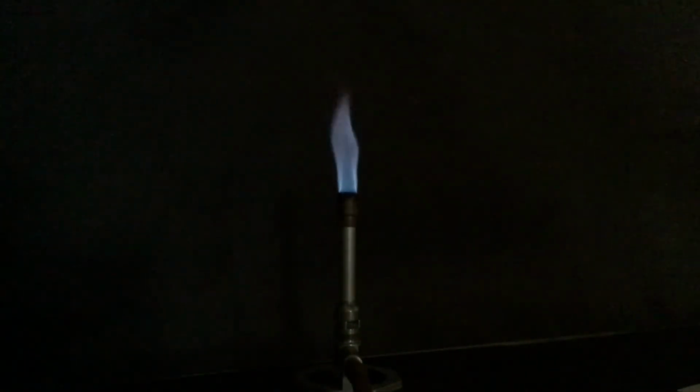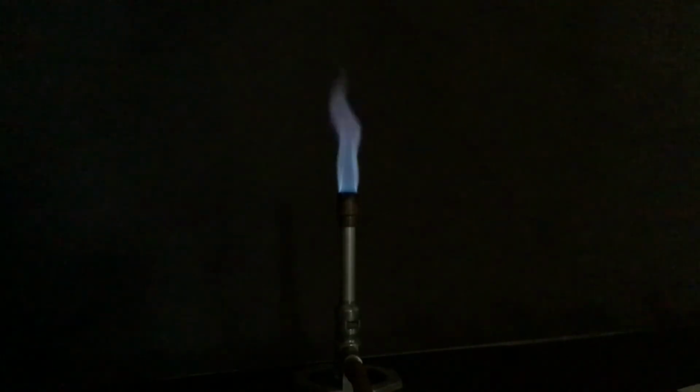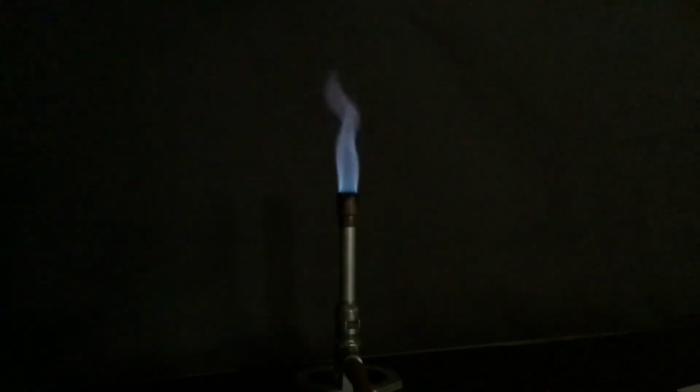All right, so there you have it, some flame tests. Again, I realize that especially on video, the colors can be pretty hard to tell apart, so please do the best you can as far as writing down descriptions for them. And in the next part, you're also going to be looking at the emission spectra of each of these substances. So you'll have that to refer to as well when you're trying to identify the identity of that unknown substance.